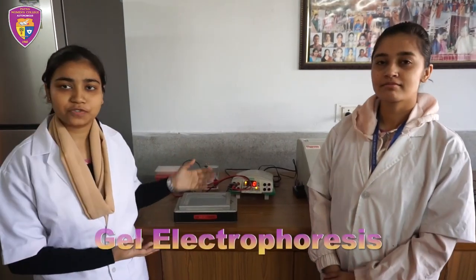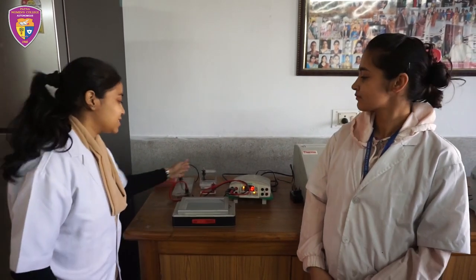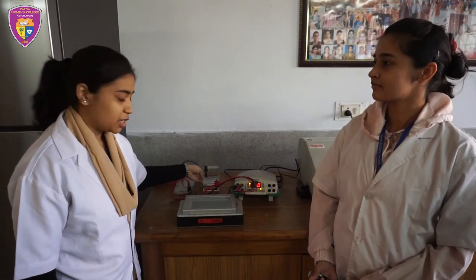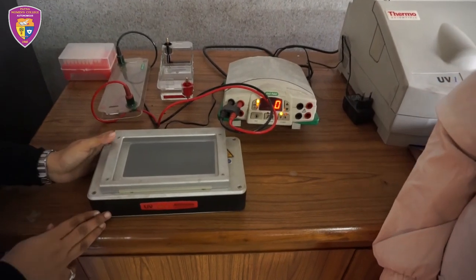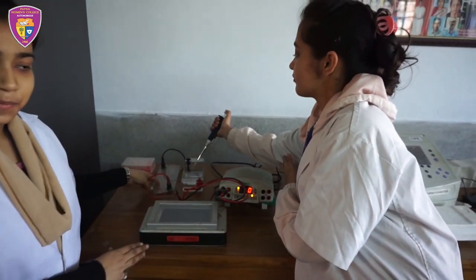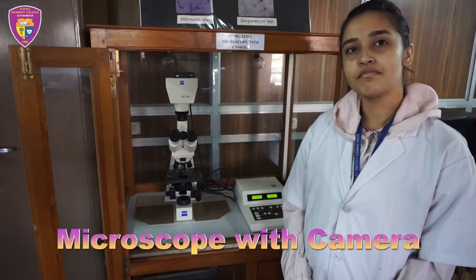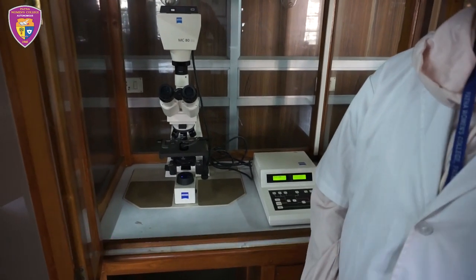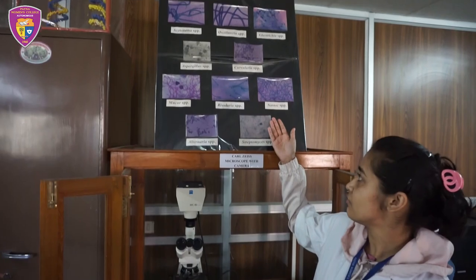This is the agarose gel electrophoresis unit. It is used to separate DNA on the basis of its molecular weight in a matrix of agarose. This is the casting gel tray where we cast the gel and this is the UV transilluminator where we visualize the DNA fragments with the help of EtBr. It also provides a microscope with a camera through which we can develop an image of a microorganism.